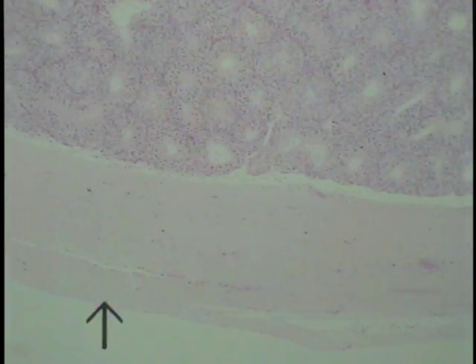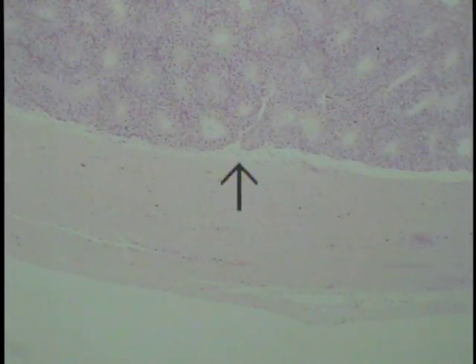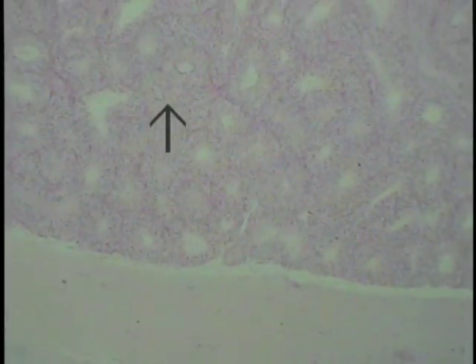Going down to the external surface of the tunica albuginea, one can barely perceive some flattened mesothelial cells lying on the external surface — this is the visceral layer of the tunica vaginalis. So we go from tunica vaginalis (that very thin mesothelial lining), to tunica albuginea, then tunica vasculosa, and finally into the seminiferous tubules, which fill the heart of the testis.